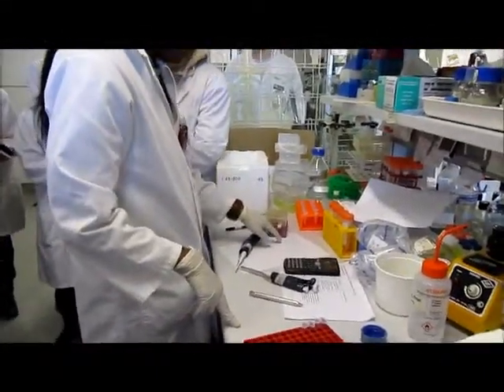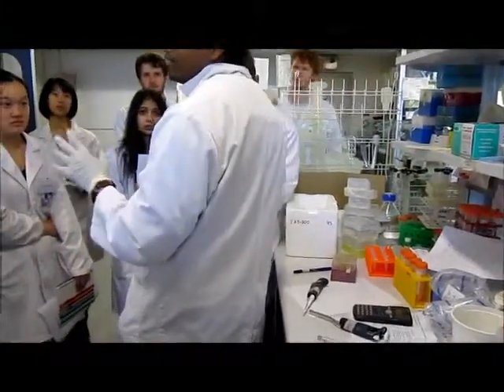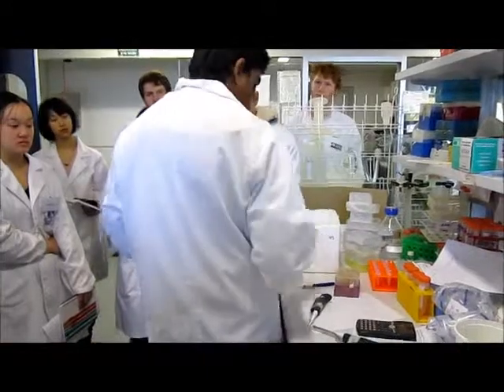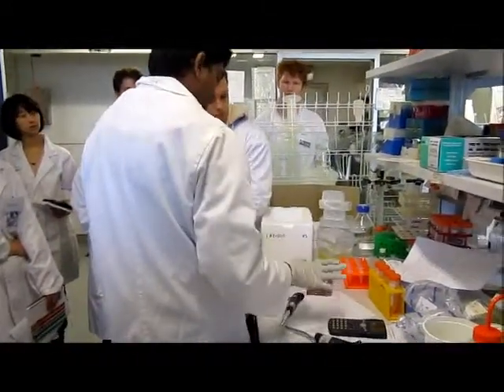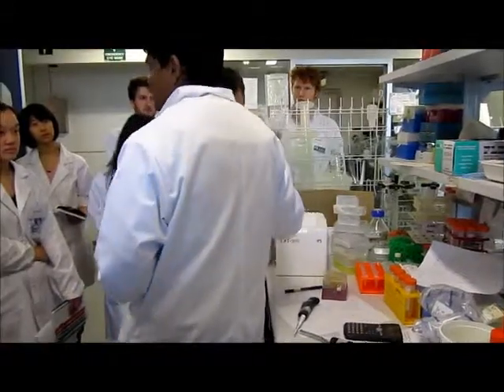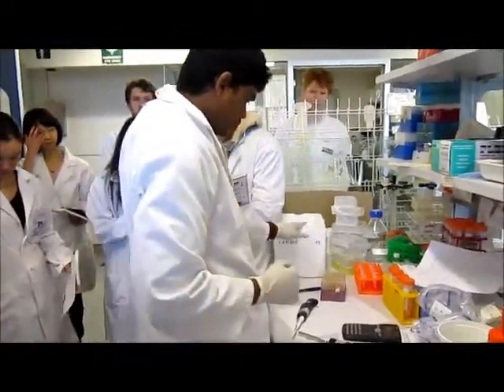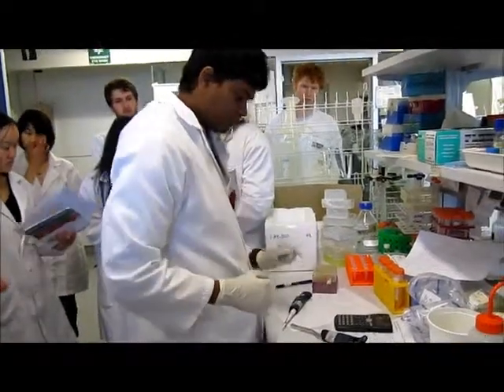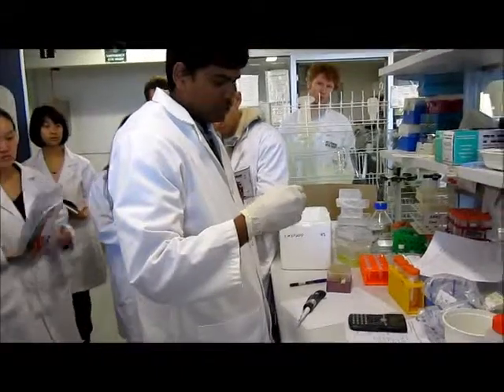So it's a good practice to use the enzyme very last. And also I don't have my enzyme here, it's in -20. So once I'm ready, I have added everything, then I'll just take this enzyme out and add it. Okay? So I have only one more thing left, that's my vector. I'm gonna take 30 microliter each.